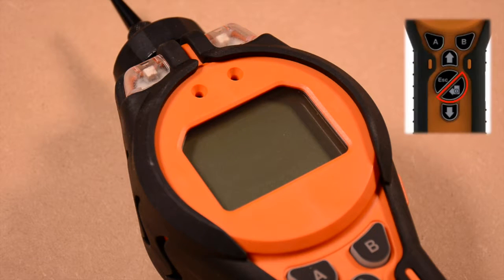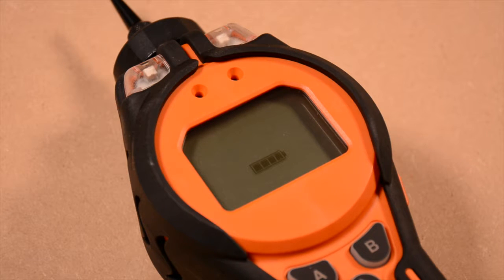You can check charge status while charging by pressing the enter key. The charge status appears on the LCD screen of the instrument.